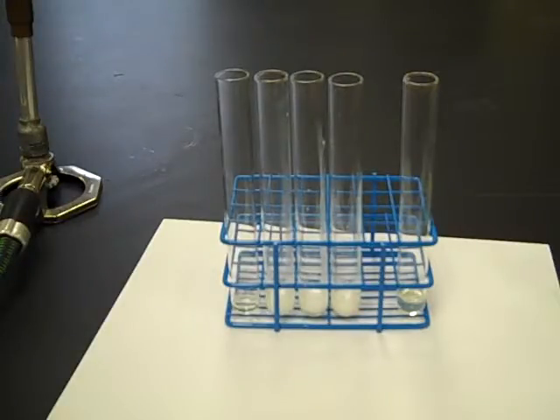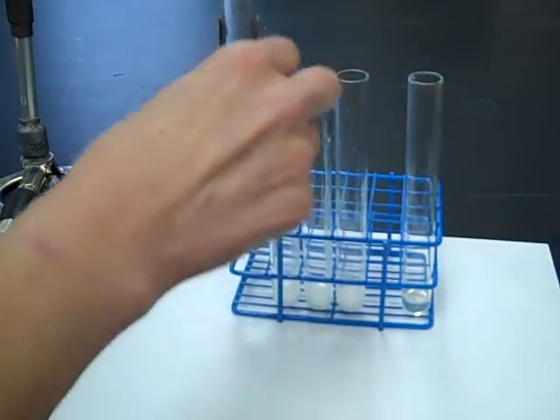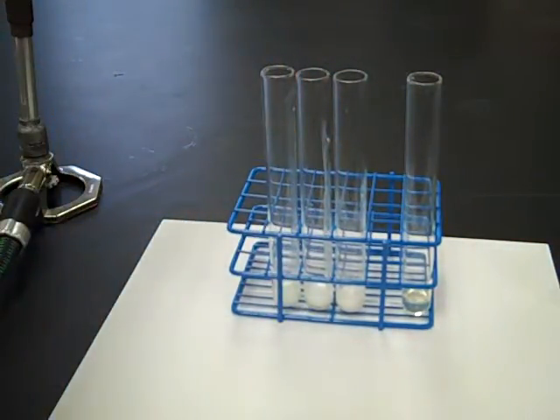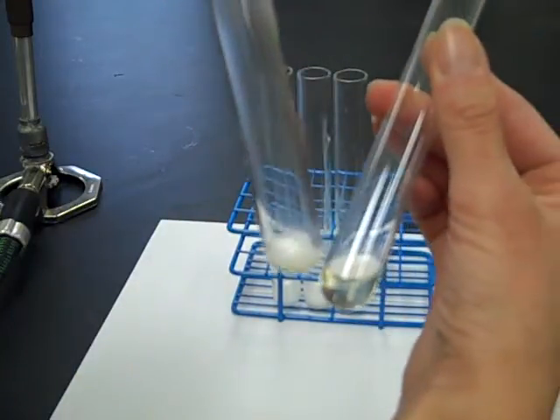Okay, we want to have a blue flame and now I'm taking the test tube and heating it. Let's see the result, compare this to the control.